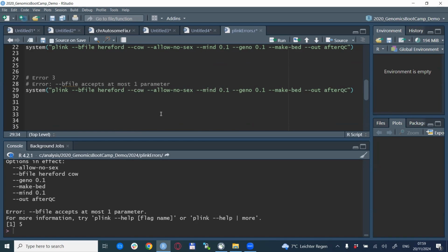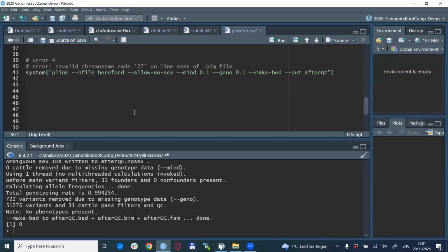So in this case, you need to check actually not the option that is displayed here. So not dash dash b file when you see about the parameters, but actually the option before or most likely after it. The next error is very frequent if you are dealing with non-human data.